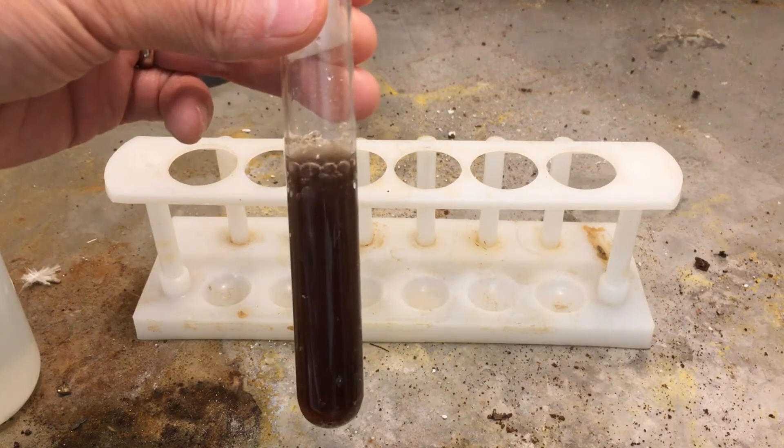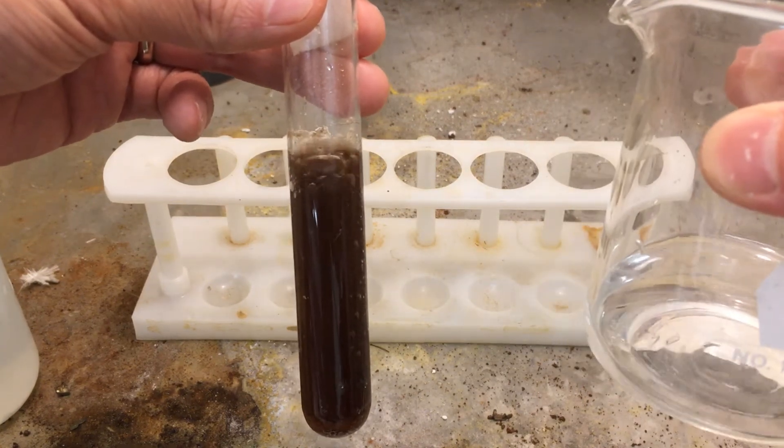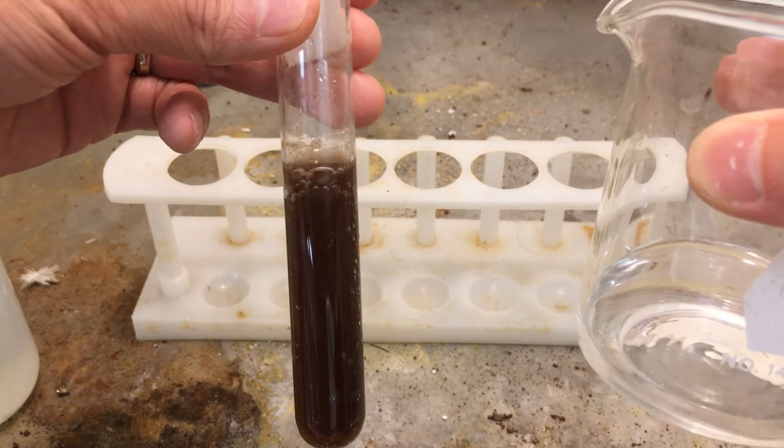All that's changing here is the hydrogen peroxide is oxidizing the iron from the plus 2 state to the plus 3 state.